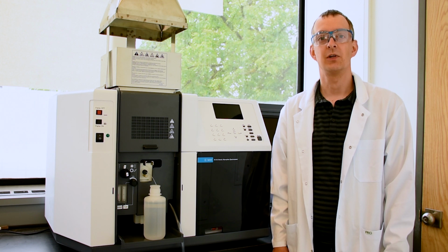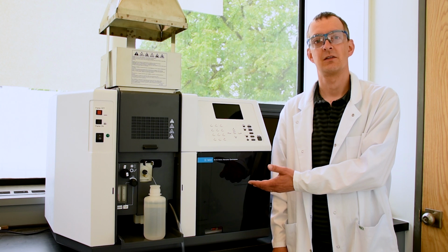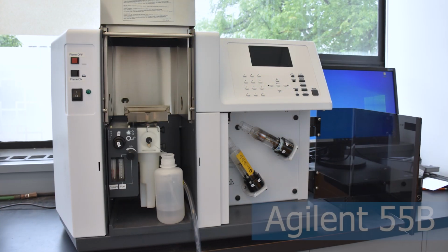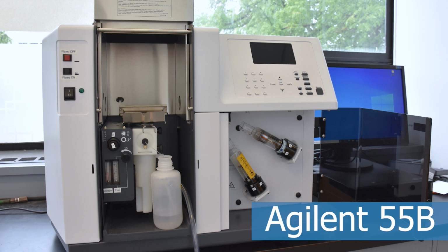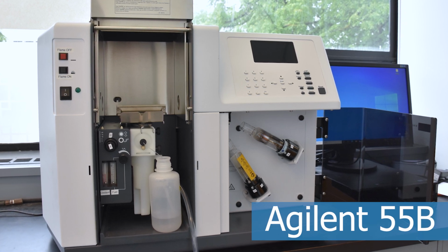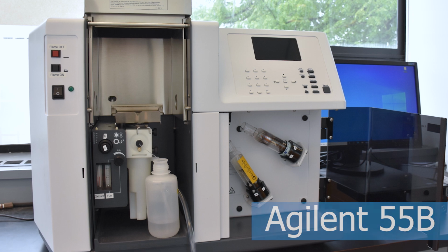I'm Dr. Robin Studley, and this video will be about the instrumental setup for atomic absorption spectrophotometry. The instrument we are looking at is the Agilent 55B atomic absorption spectrophotometer. What we see today will be very typical of a double beam atomic absorption system.